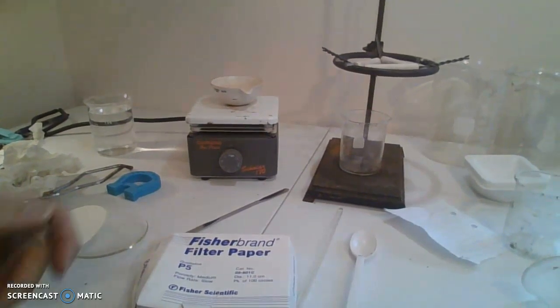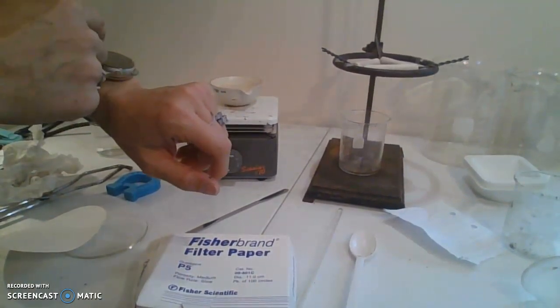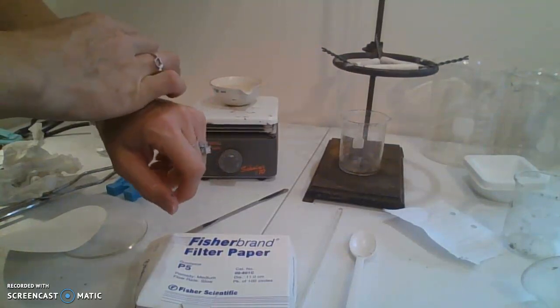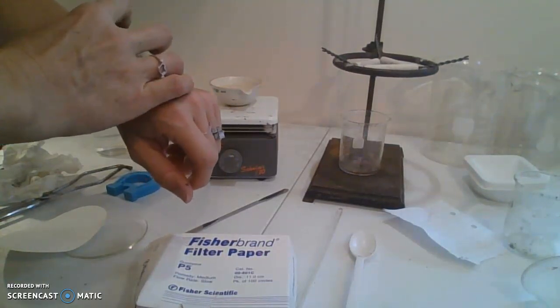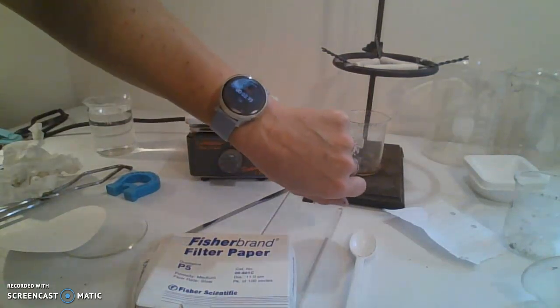So we are going to start the timer. Here we go, we're going to start.